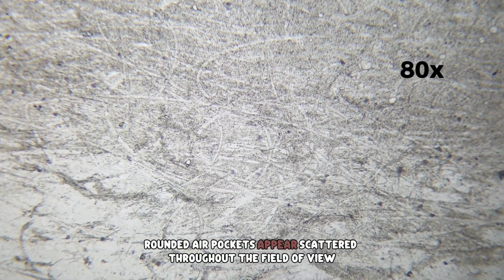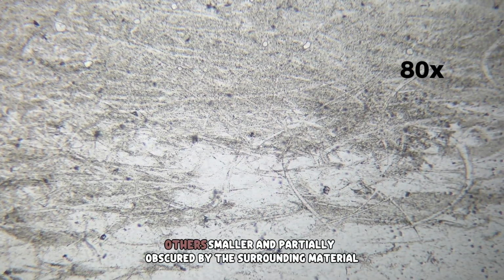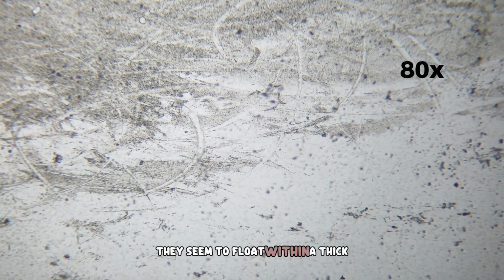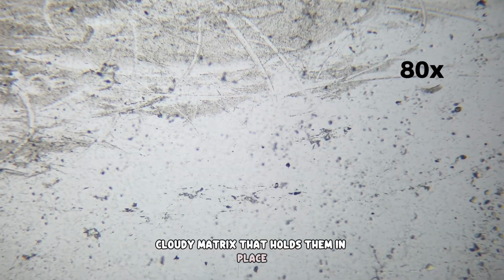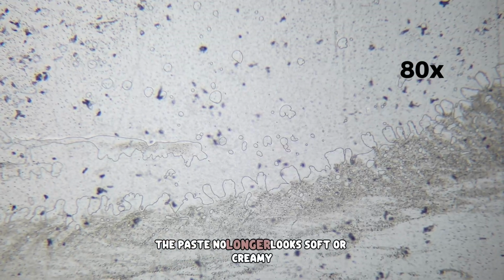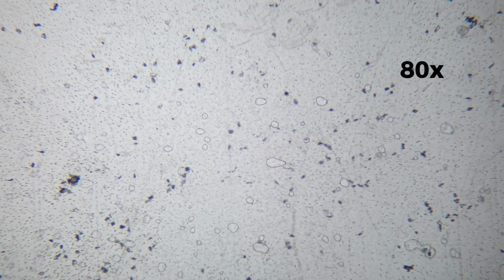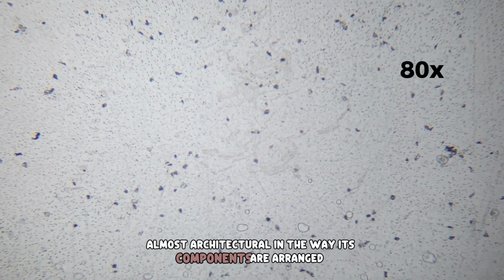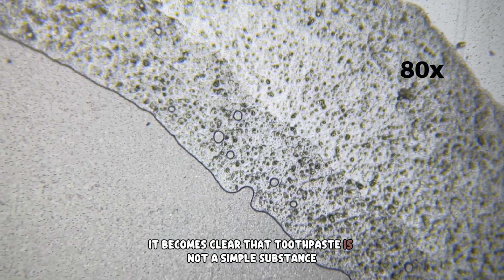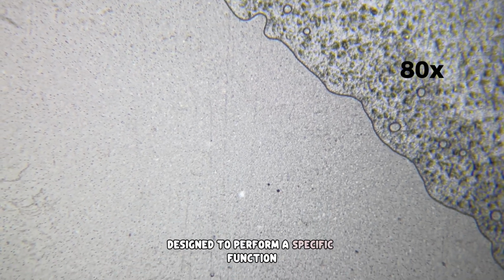Rounded air pockets appear scattered throughout the field of view, some large and clearly outlined, others smaller and partially obscured by the surrounding material. They seem to float within a thick, cloudy matrix that holds them in place, preventing them from rising or merging. The paste no longer looks soft or creamy. Instead, it appears structured and compact, almost architectural in the way its components are arranged. Even at this early magnification, it becomes clear that toothpaste is not a simple substance, but a carefully balanced suspension designed to perform a specific function.